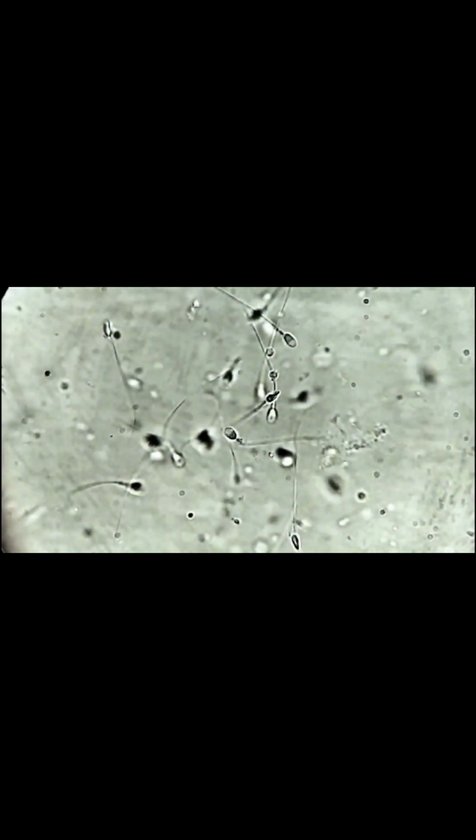Sperm morphology assessment looks at the proportion of sperm cells with abnormal shape or morphology against normal cells. Defects in the morphology of a sperm cell, also known as teratospermia, can be classified as head defects, neck and midpiece defects, tail defects, and cytoplasmic droplets.